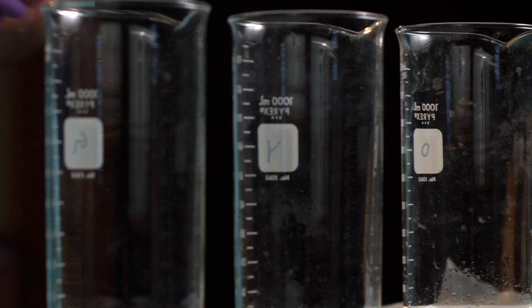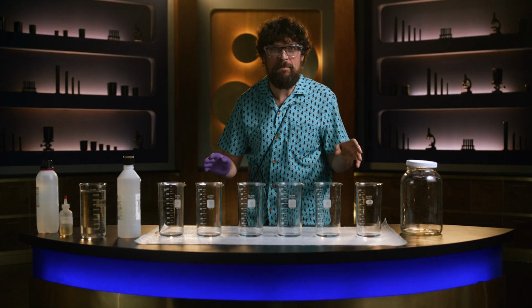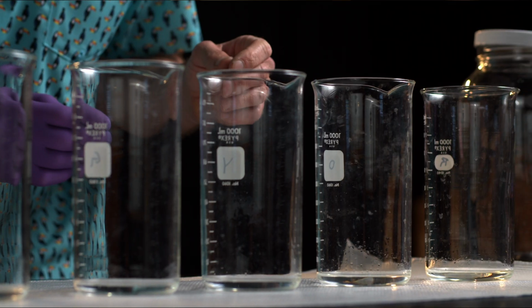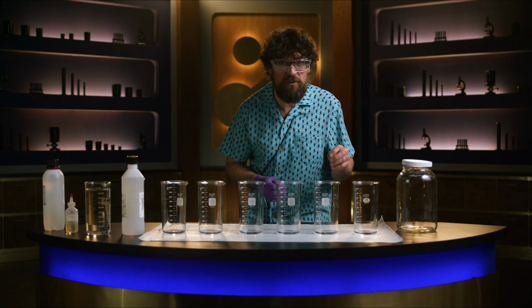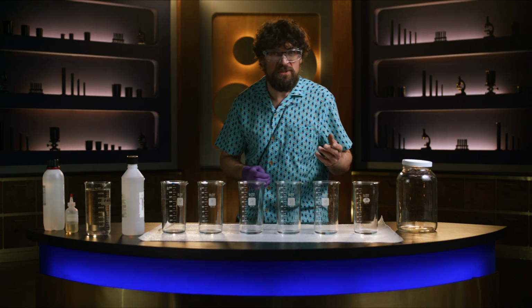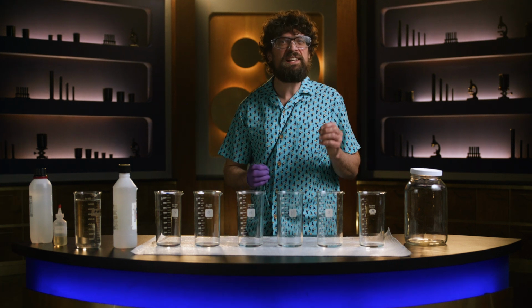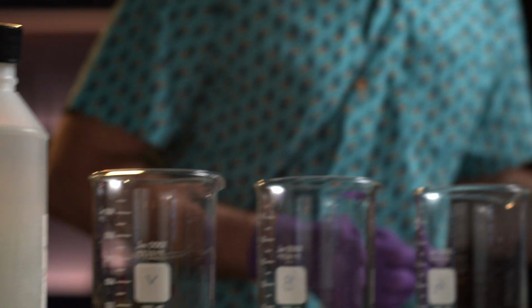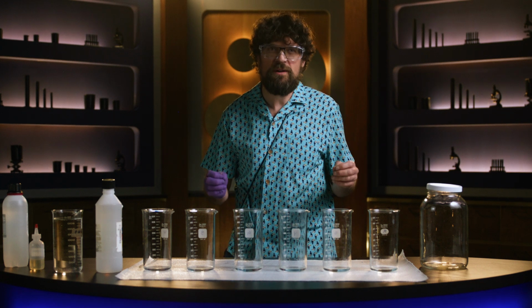Here, we have 6 seemingly unremarkable beakers, but hidden within them lies the potential for a rainbow connection, if you will. These beakers each contain a little acid-alcohol mixture and just a pinch of different pH indicators, chemicals that change color based on the hydronium ion concentration of their environment. But to unleash their colorful potentials, we'll need to add a dilute sodium hydroxide solution, our base. But first, let's talk about how this works.